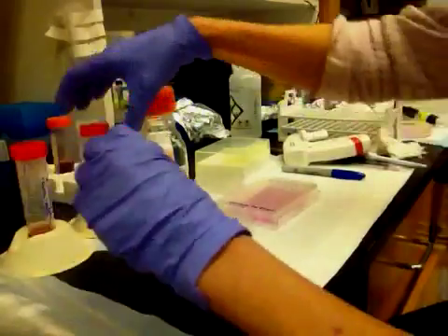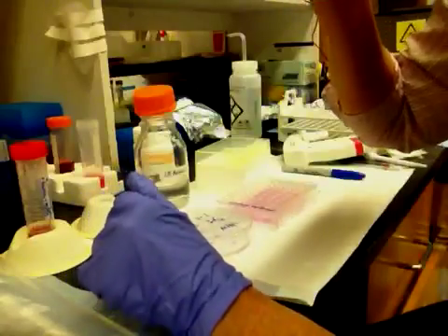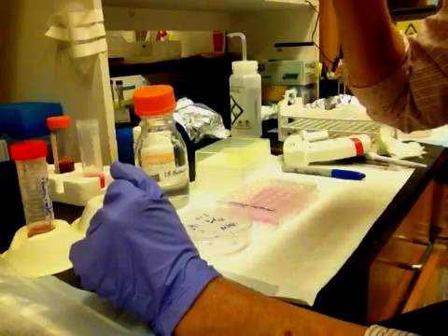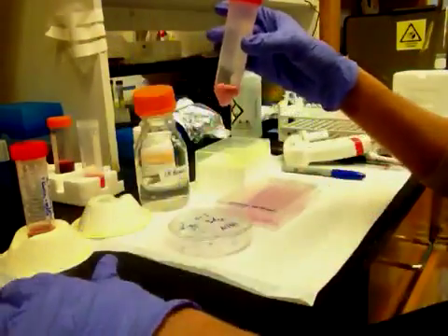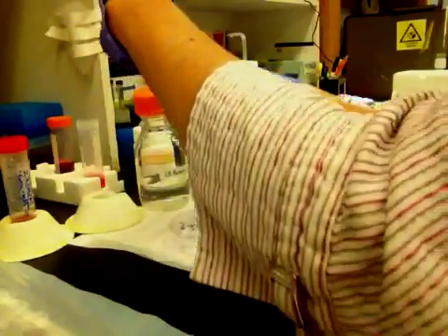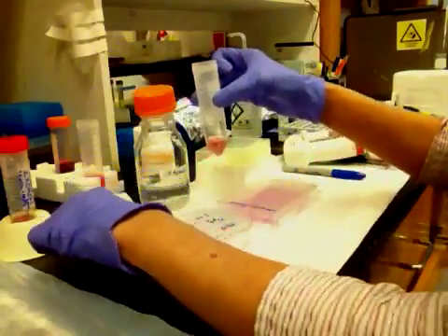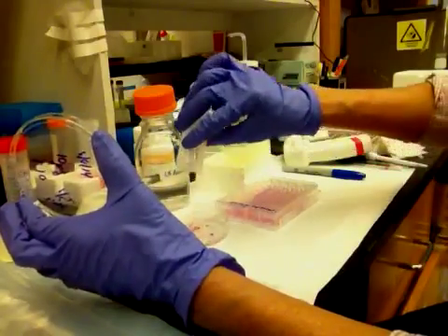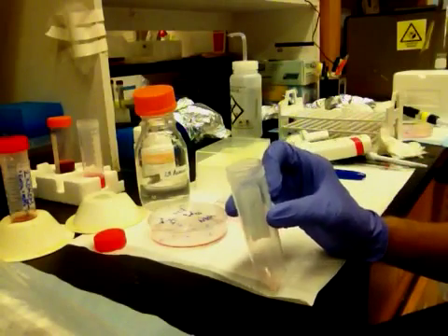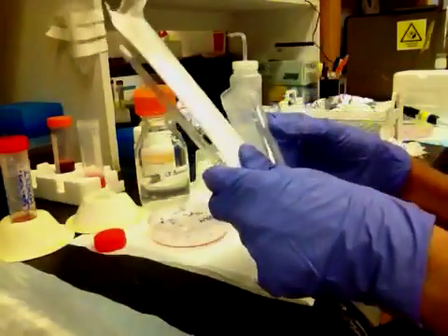How do you know whether this is ready to pour on the cells? You put it on your cheek — it's more sensitive than your hand. It should just be barely warm. If it's at all hot or a little too warm, your cells will not survive. So if it's still warm but hasn't yet started to form solid agarose, you're ready to go. Then you simply lift the plate and pour it on there. This provides a nice moist layer of isotonic gel to keep all the cells happy while you're picking them.